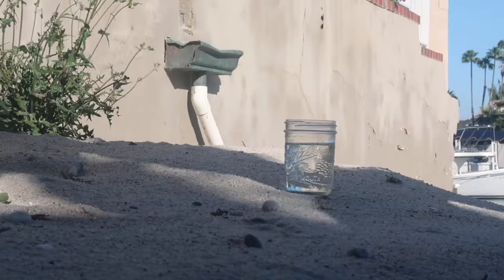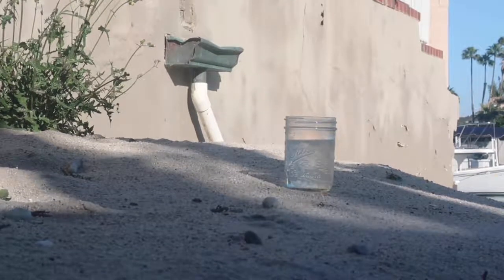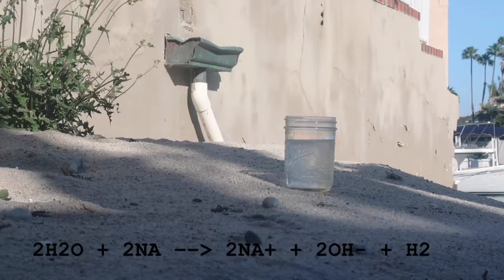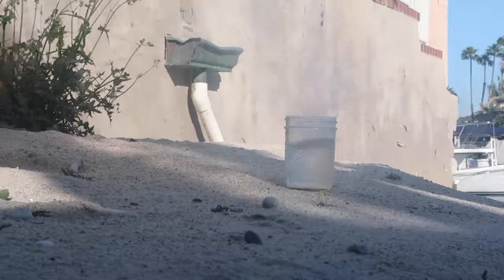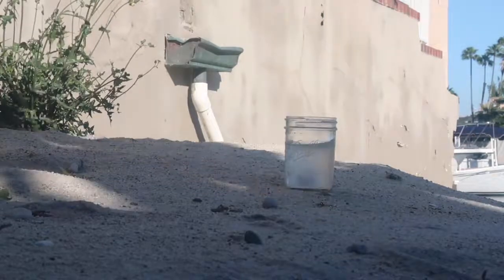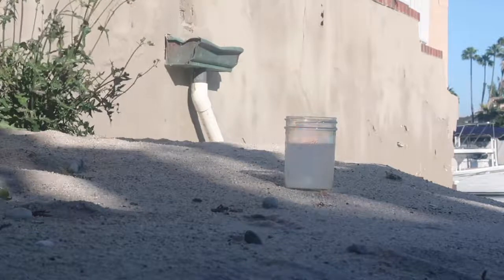And finally, sodium and water. All I had to do for this reaction is throw a chunk of sodium metal into a glass of water. The sodium fizzles around on the surface until, bang, it explodes. The water molecules violently rip away the outside electrons from the sodium atoms, causing an explosion.